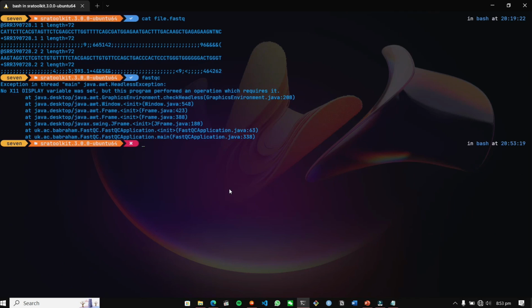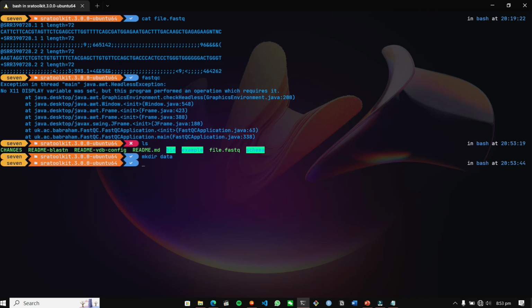For checking the quality, now that we are in this folder, we have the file.fastq. We're going to check our data quality. We're going to make a directory with mkdir, which I'm going to name data, and now I'm going to check. Yep, the data folder is created. I'm going to apply the FastQC tool on our file.fastq and generate the output into the data folder.